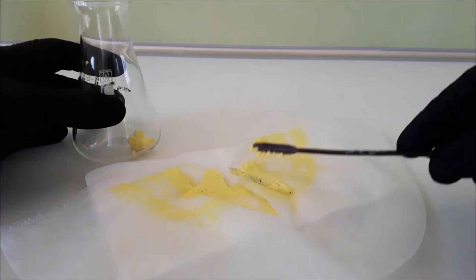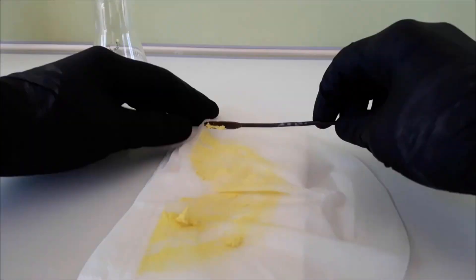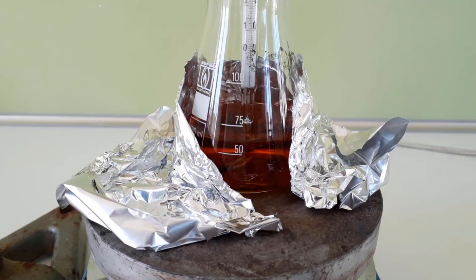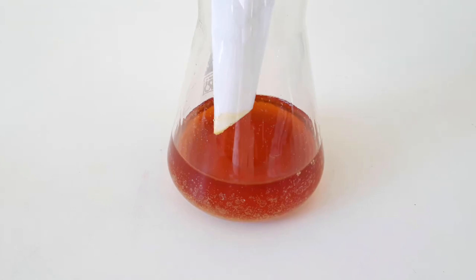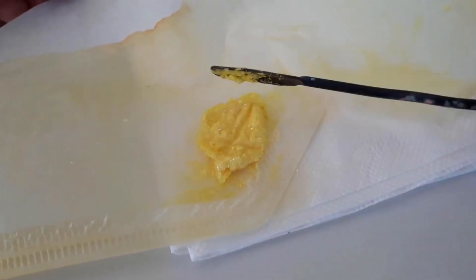Hi, so since my iodoform synthesis video has got a significant number of views, I figured I can show some of the properties and a couple of reactions of this awful chemical.